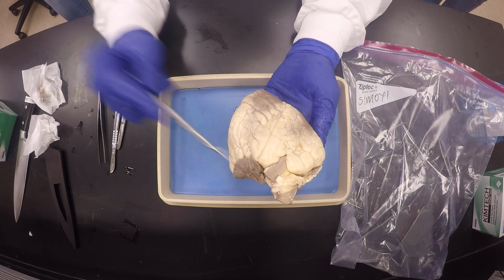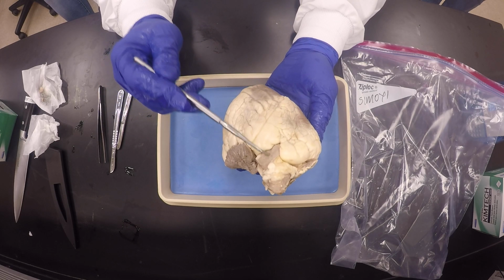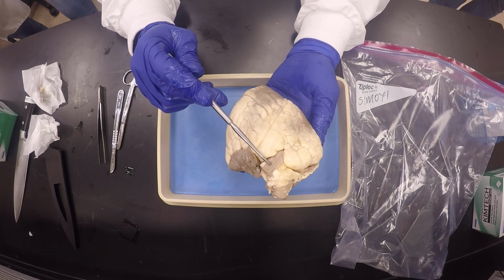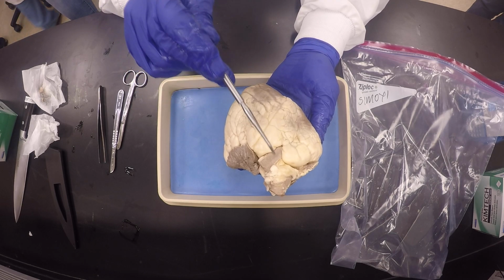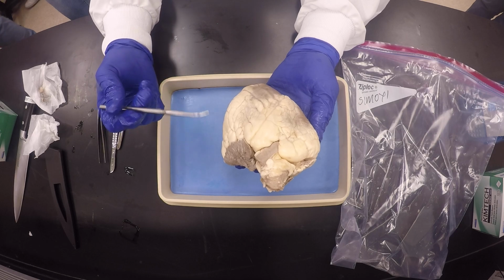And so the anterior interventricular sulcus shows you that this is when you see this diagonal line going like this. Then you confirm indeed that it is the anterior side, because you see the pulmonary trunk leaving the right ventricle. The pulmonary trunk is splitting into the left and right pulmonary arteries going to the lungs. So you can confirm that, yep, this is the anterior side because you see the pulmonary trunk right there.